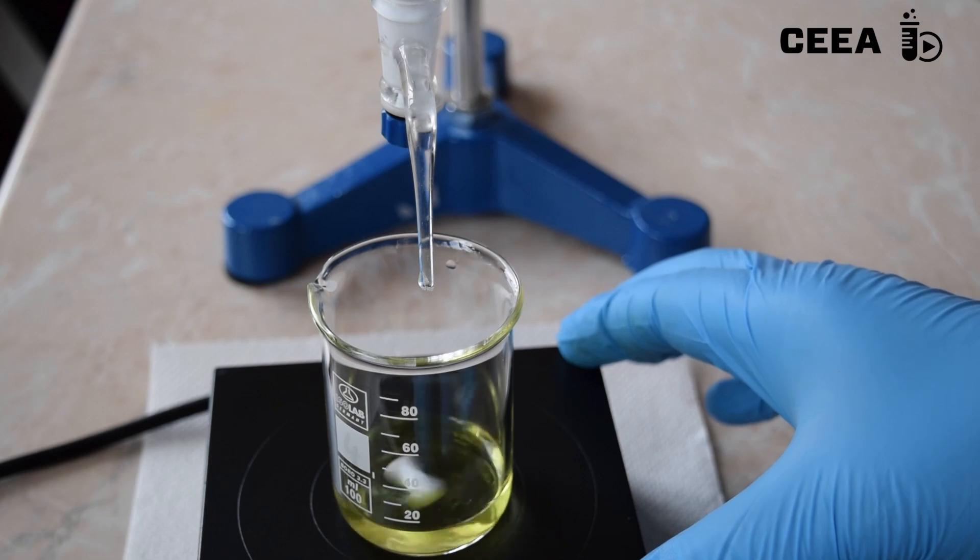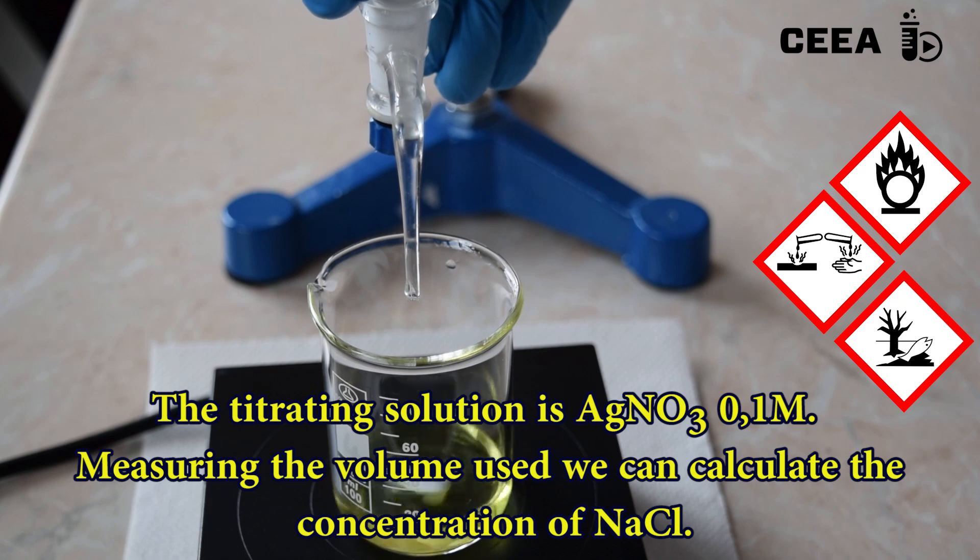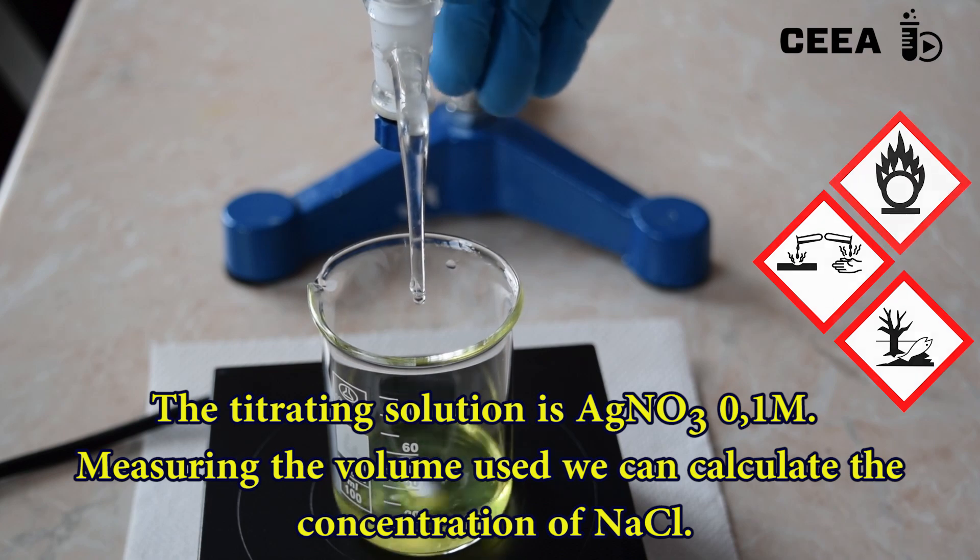Place the beaker on a magnetic stirrer and titrate the sample with 0.1 molar silver nitrate.